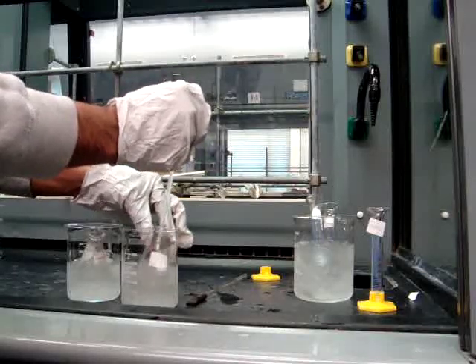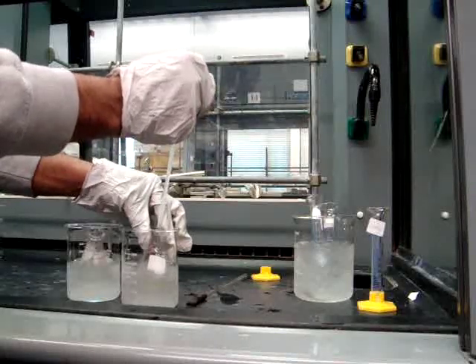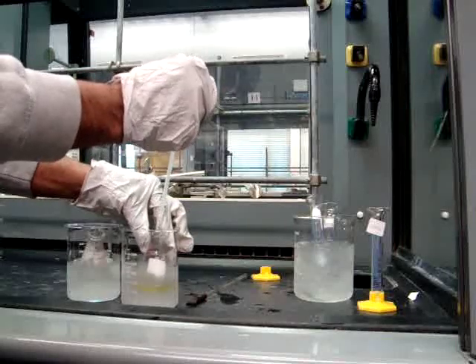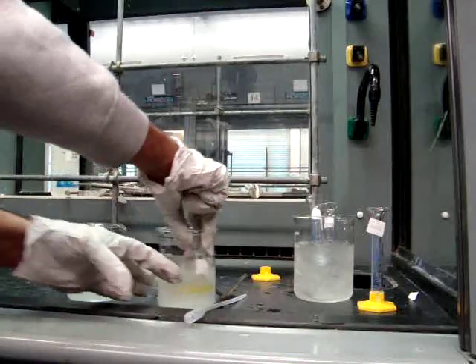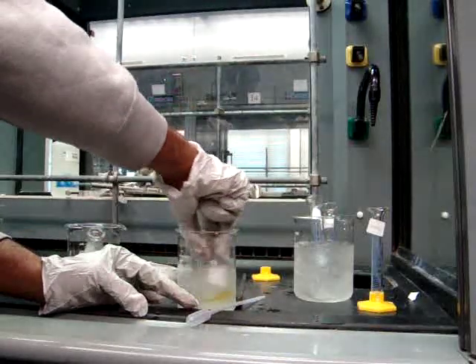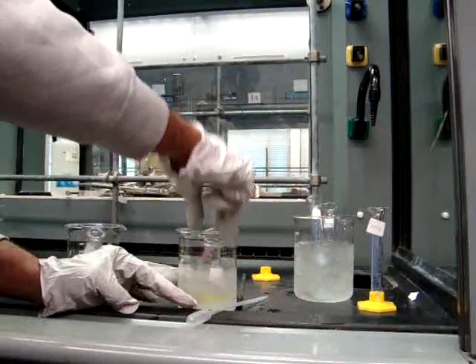After the addition is finally complete, you want to let the resulting mixture stand at room temperature for an additional 15 minutes with occasional swirling. As you can see, as you add the mixture to your reaction flask, you will continue to swirl within the ice bath to keep it cool while you add it.